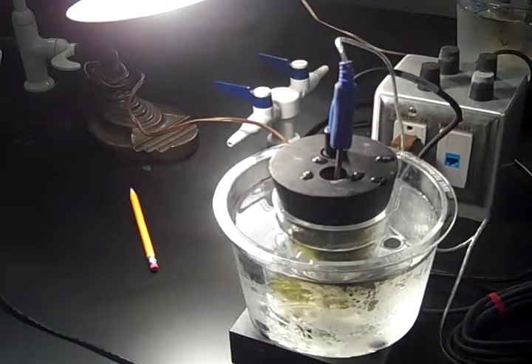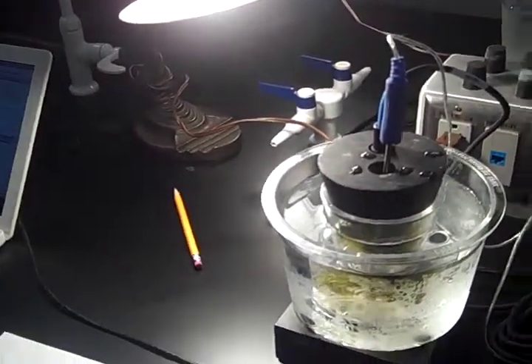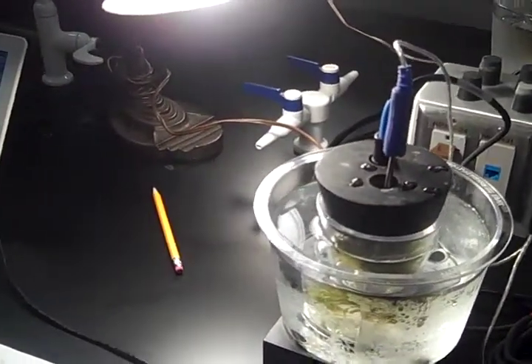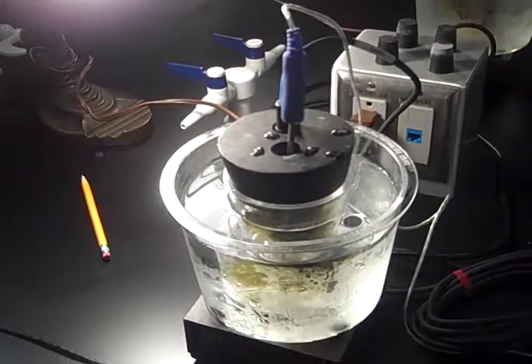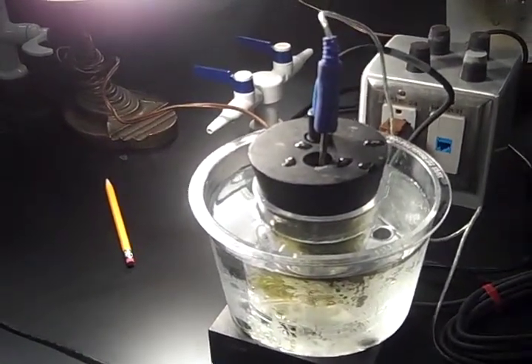Okay, so shown in our previous graph, the dissolved oxygen went down, but we do believe that the plant is undergoing photosynthesis. It just creates oxygen that isn't dissolved into the water. If I zoomed in close enough, you could see air bubbles, and there is oxygen being created. It's just not dissolved inside the water.